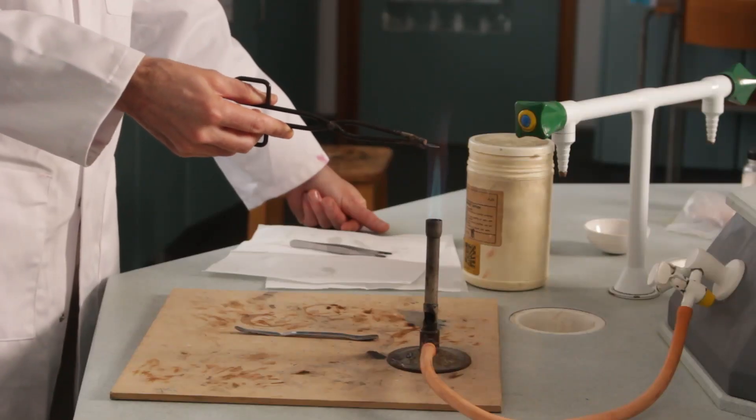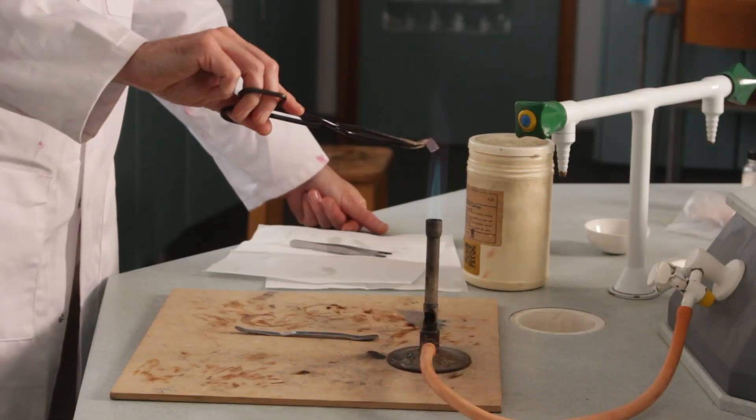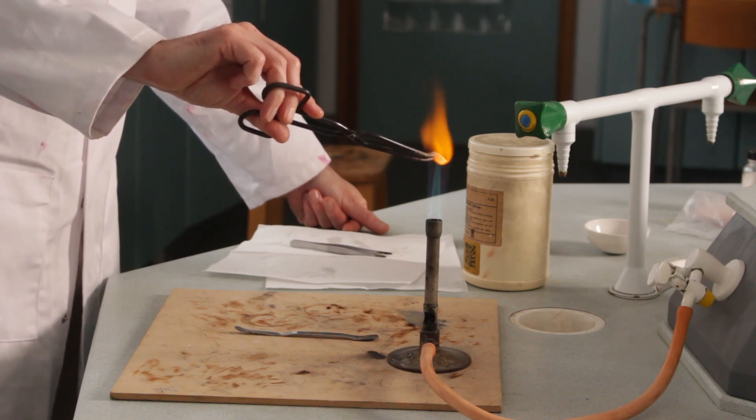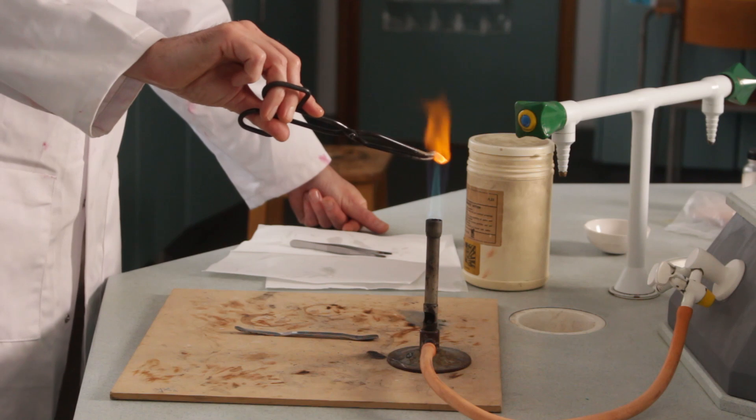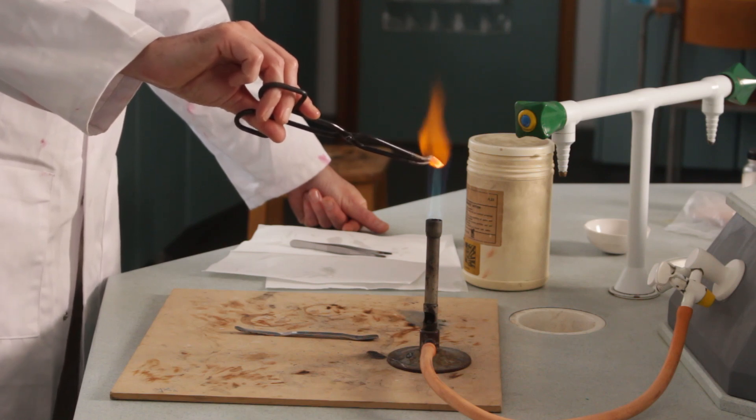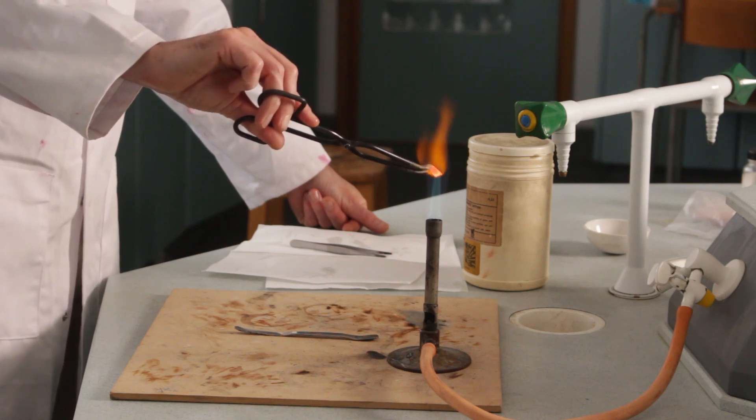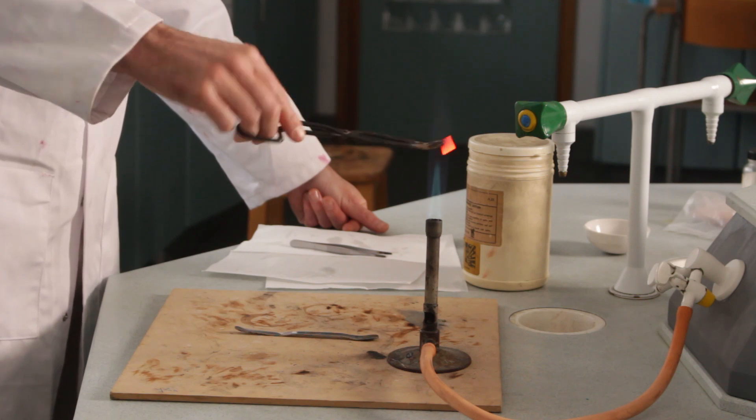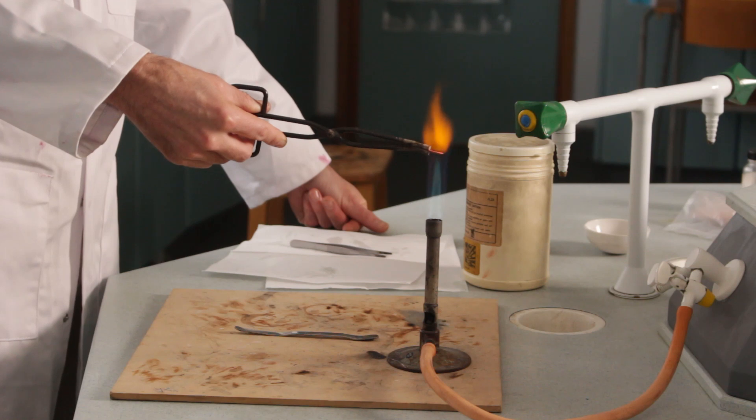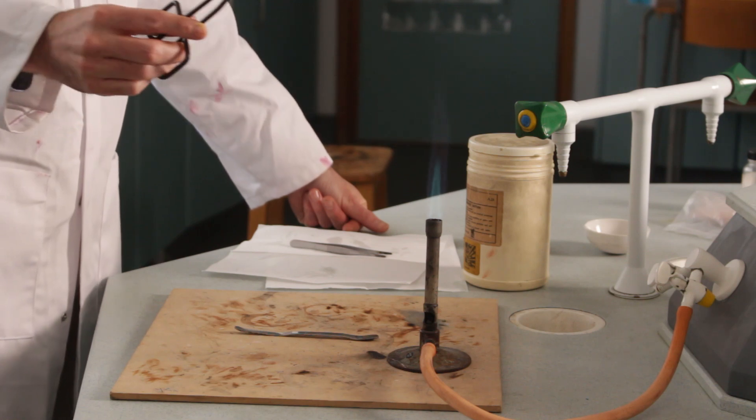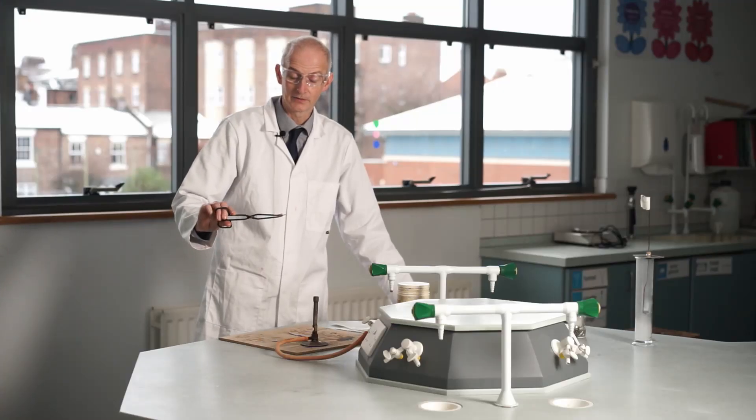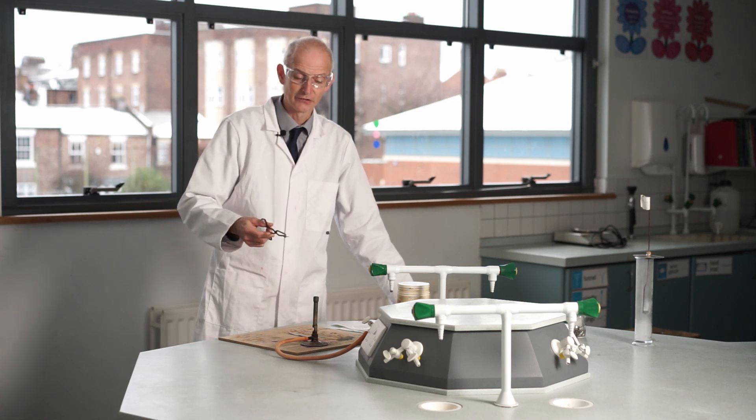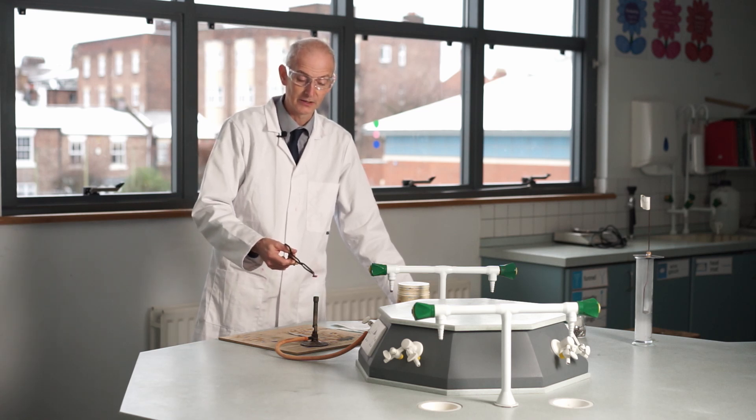Keep a close eye on it. I'll just put it in for a couple of seconds and it's already gone black on the surface. It was a very quick reaction there on the surface, and if I hold it in for longer I'm going to make it glow red. I'm going to get it as hot as I possibly can so it's glowing red, and you can hear the power of the flame there on that. But it's not igniting.